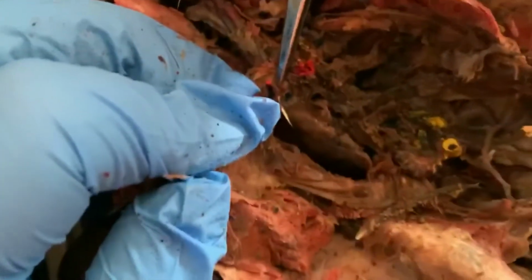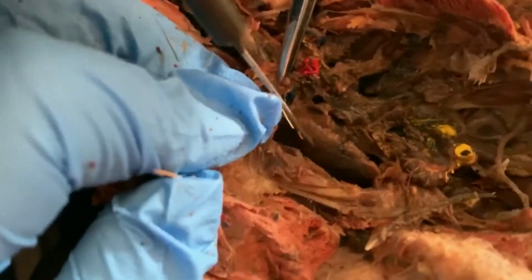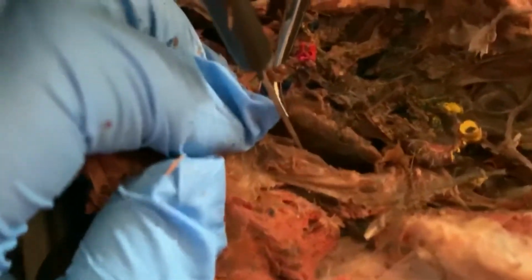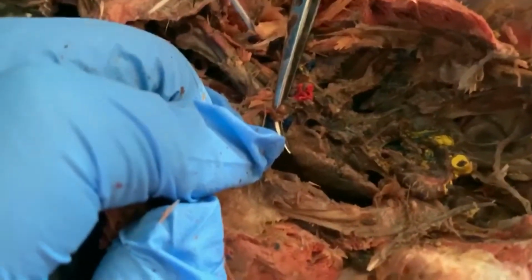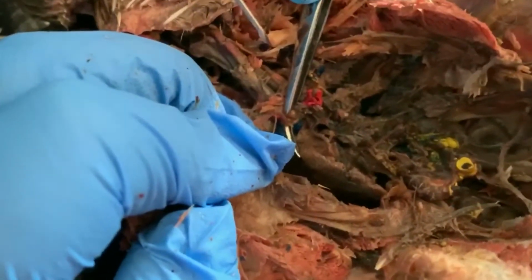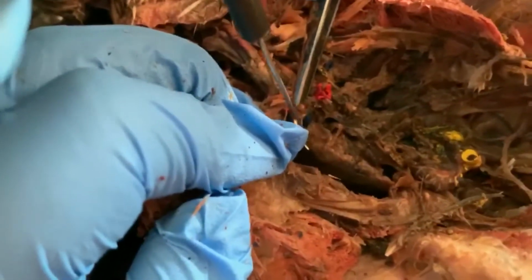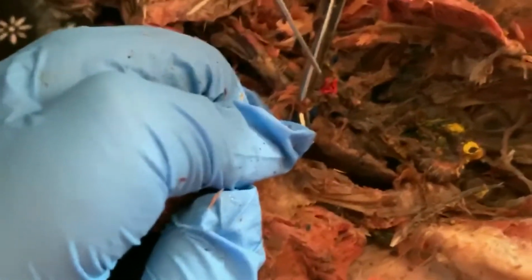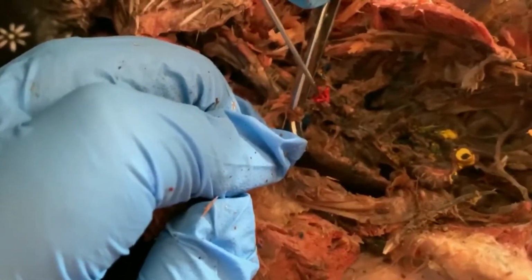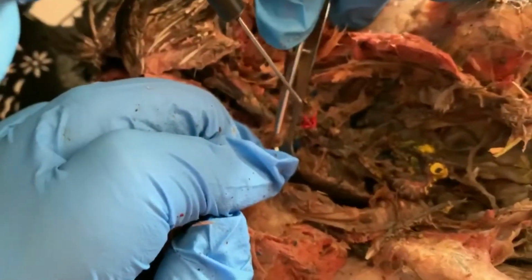All right, so looking here, you can get a better view of the lungs. They were right there, up against the outside of the rib cage. These lungs have tiny air sacs all around the outsides of them. You can see these little bumps, and those are the part that actually inflate with air. Of course there was enough room in this chest cavity for those lungs to inflate pretty large.